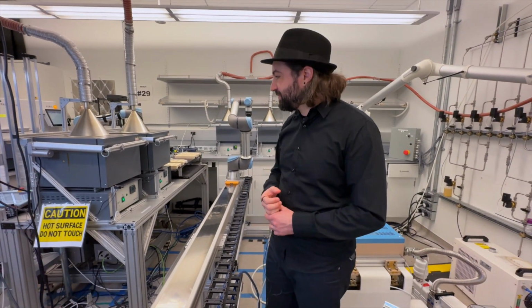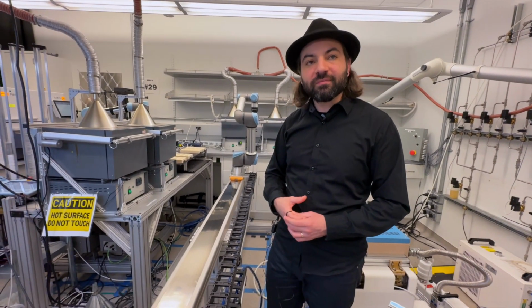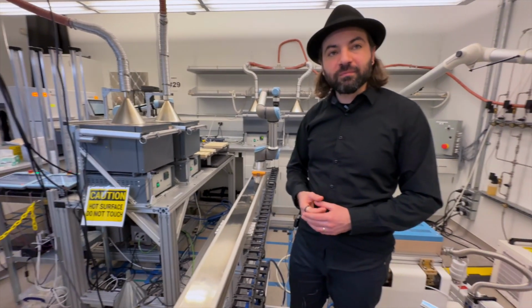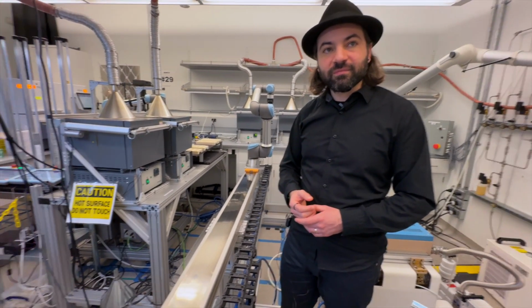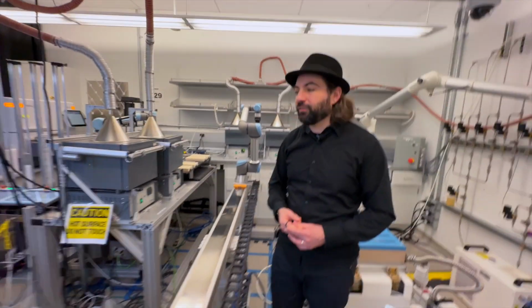I notice you have 4 furnaces here. Tell me about the need for 4. My natural question is, are there multiple flows happening at the same time, where as something is baking, you can create another experiment and have a lot of parallel processing? Yes, definitely. This is what happens.